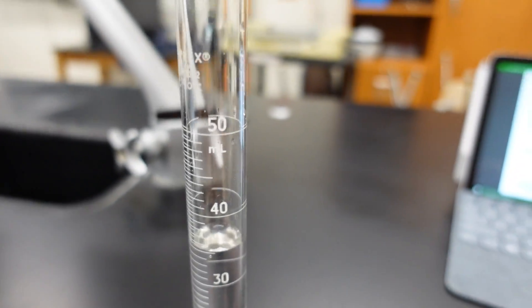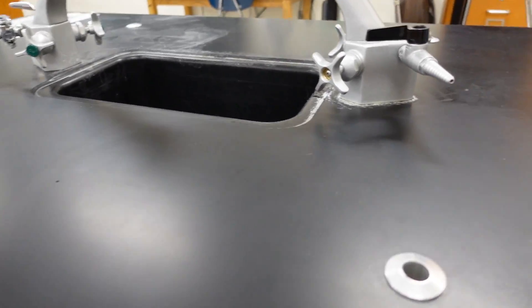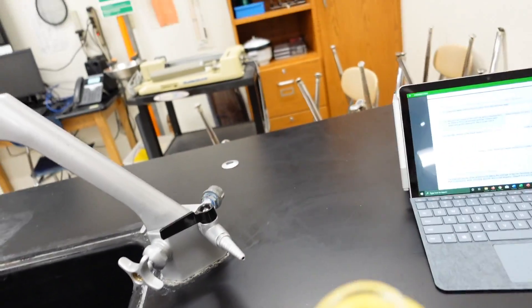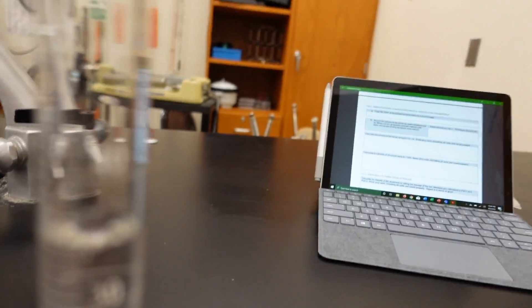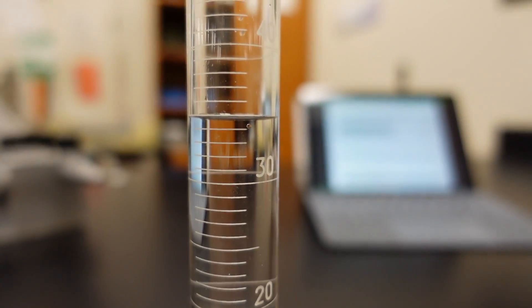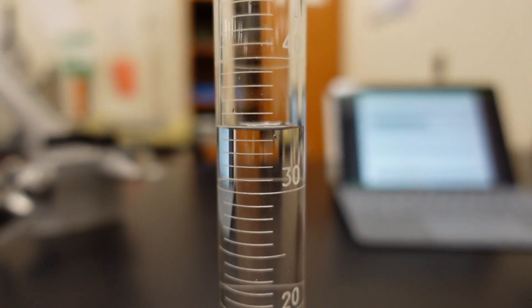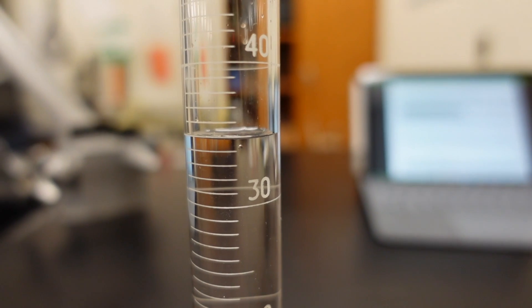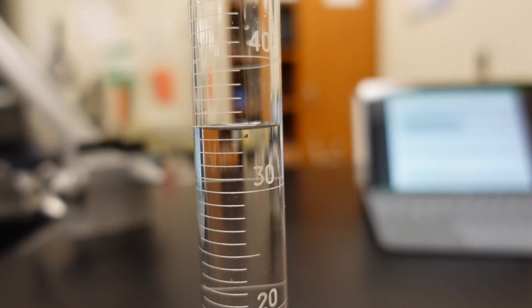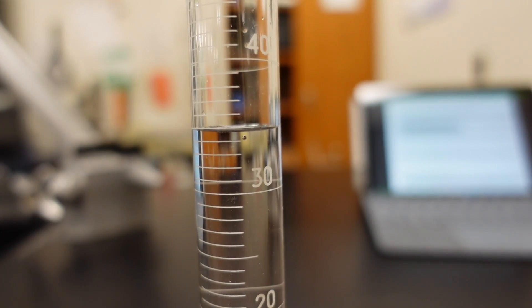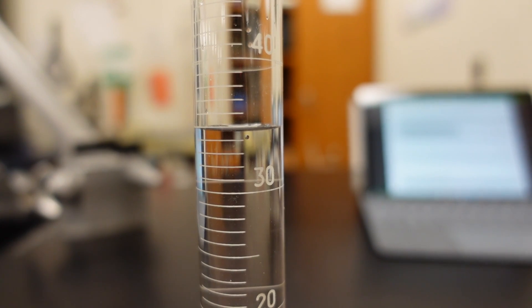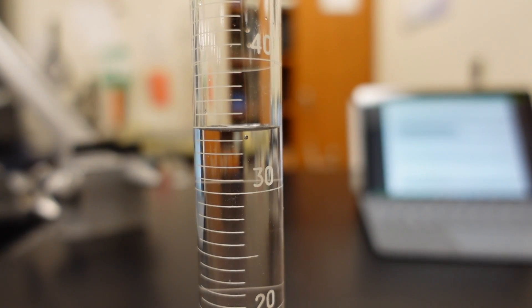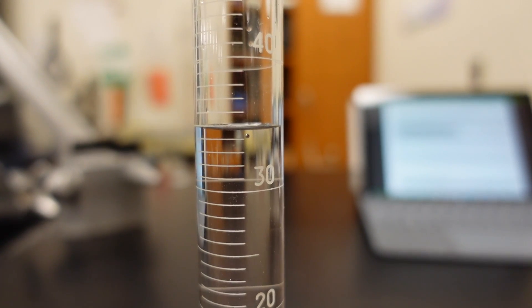Okay. I mean, air bubbles. Water bubbles. And let's find the volume with the cylinder in place. There we go. All right.